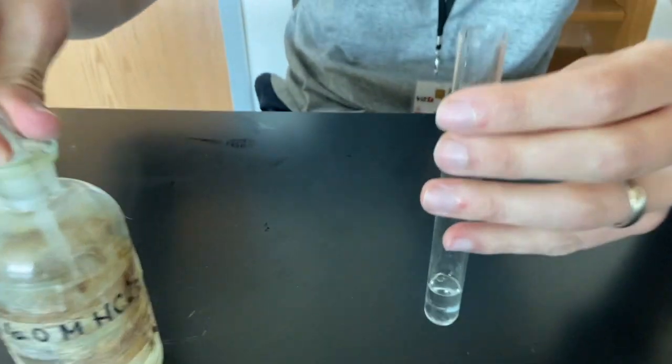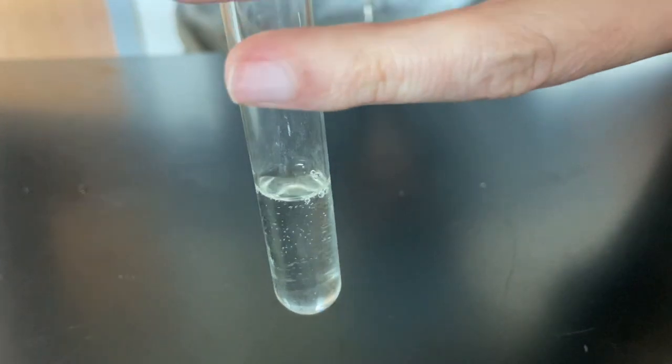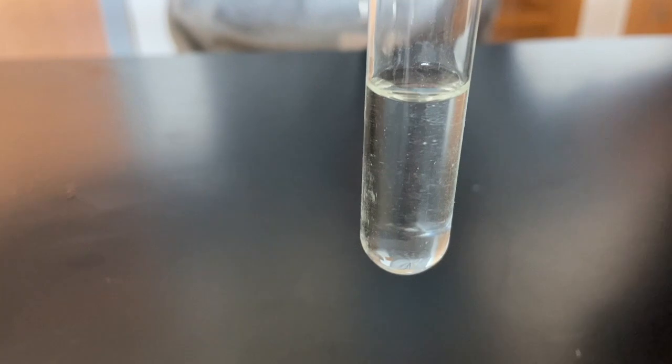As you can see me pouring it into this test tube, make your observations on that as well, similar to how we've described in the other demos.